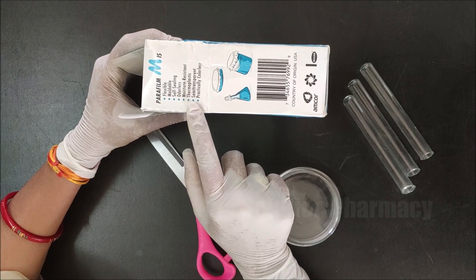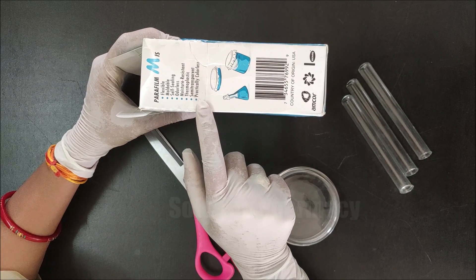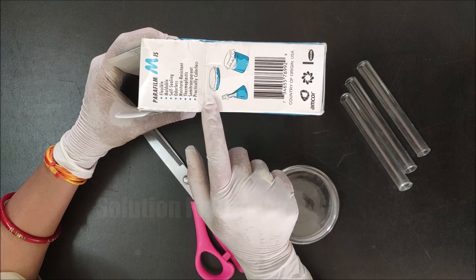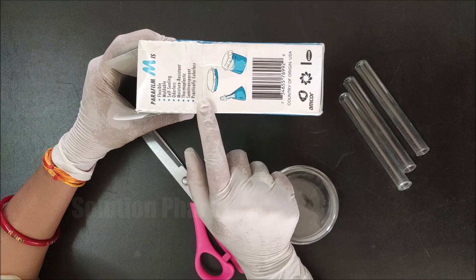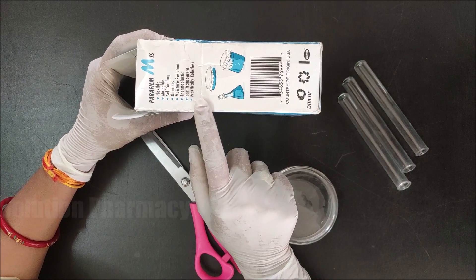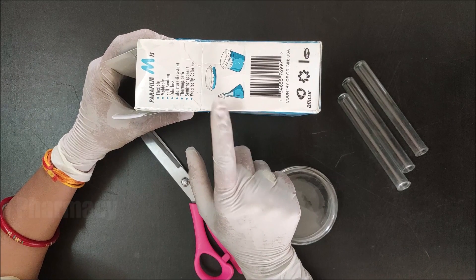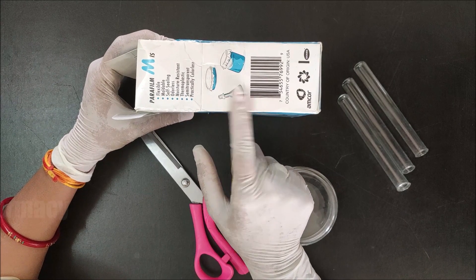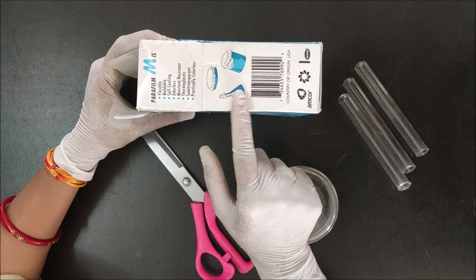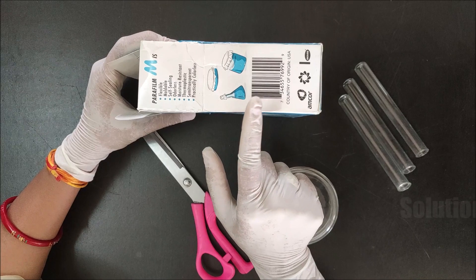Parafilm has a self-sealing property, meaning only by stretching and pressing this film we can seal the material. That is why this film is used for waterproof, liquid-proof, and moisture-proof sealing. It is odorless and moisture resistant, preventing the entry of moisture. It is thermoplastic, semi-transparent, and practically colorless.